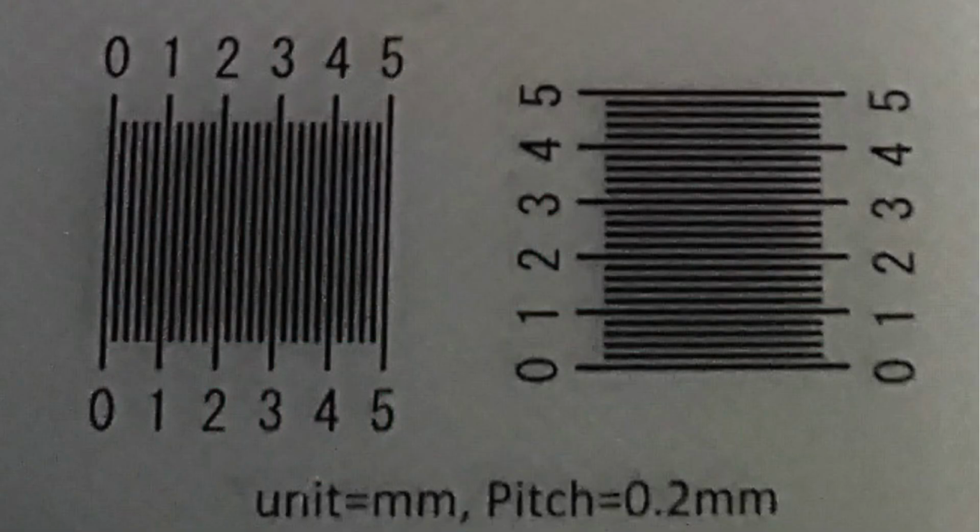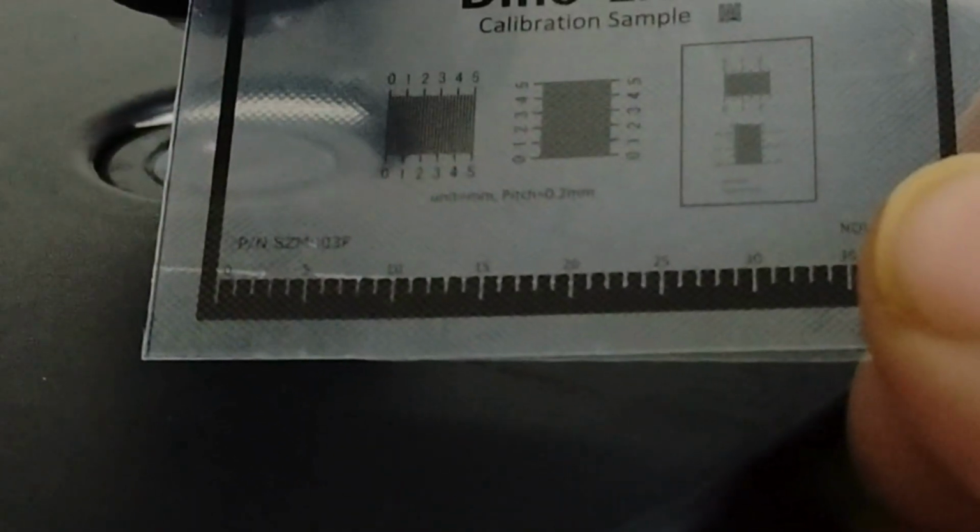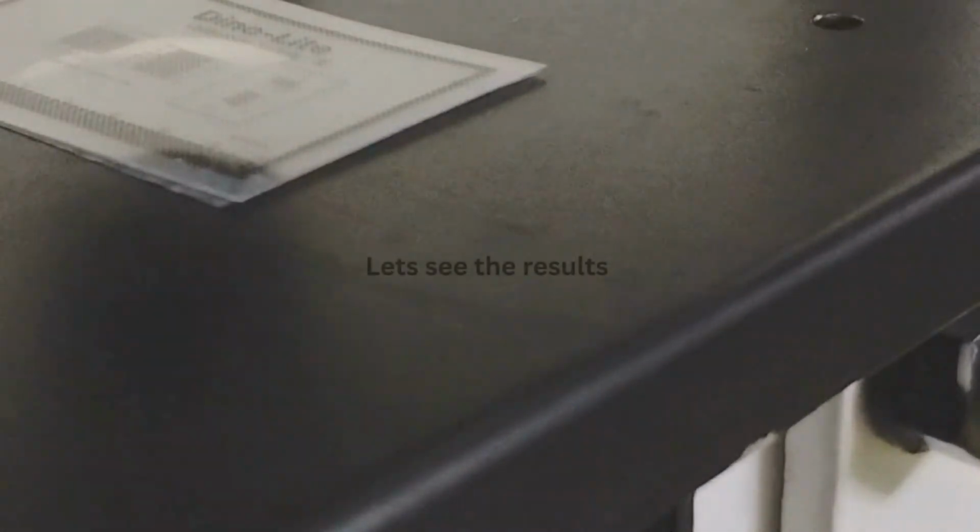So to confirm our measurements, I've used a printed stage micrometer, and the least count of this is 0.2 millimeters. To calibrate, I placed the stage micrometer instead of slide on the stage, and I took images of graticule with the stage micrometer. If you don't have a stage micrometer, you can think of placing a graph paper and lights from top. It should certainly work up to 100x or 150x.